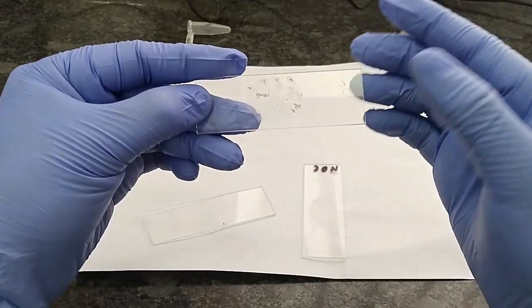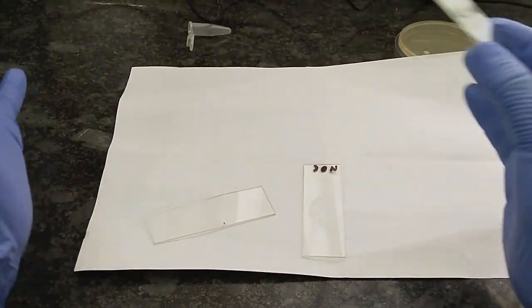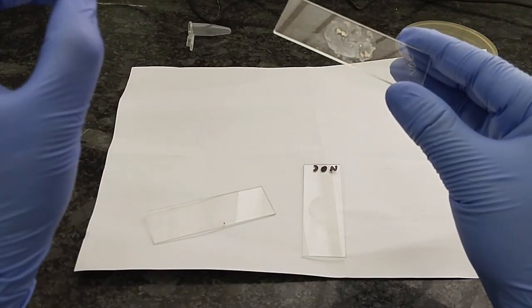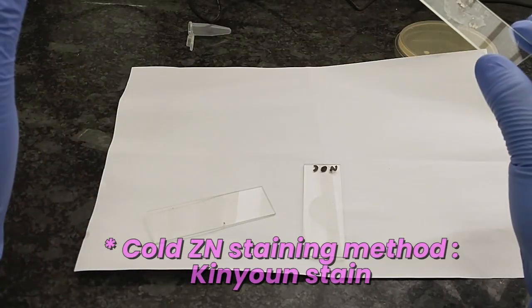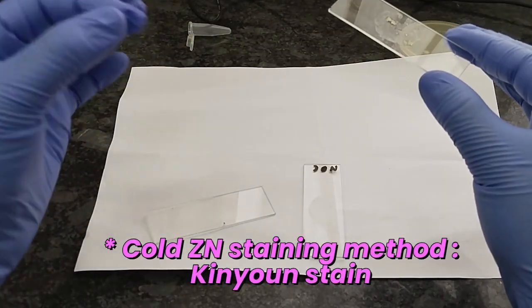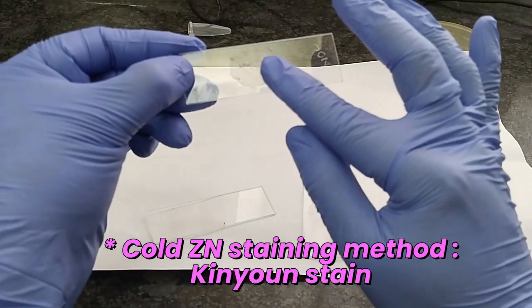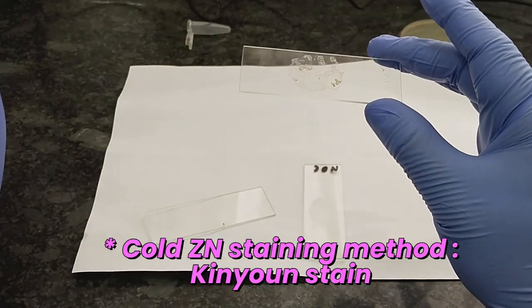So now we have to stain it by modified Ziehl-Neelsen stain. Modified Ziehl-Neelsen stain uses carbol fuchsin, unheated carbol fuchsin. In modified Ziehl-Neelsen staining we need not heat the carbol fuchsin. So just pour the carbol fuchsin on the slide and leave it for 8 to 10 minutes.